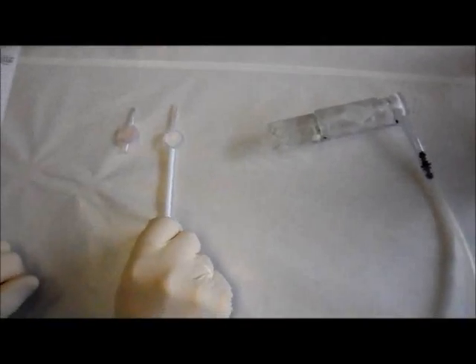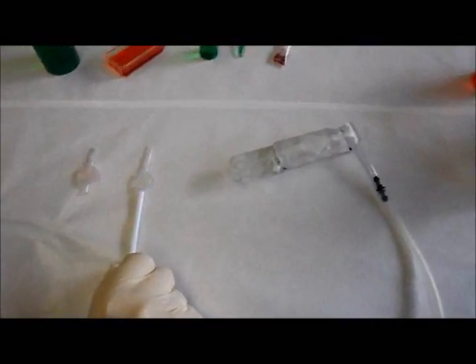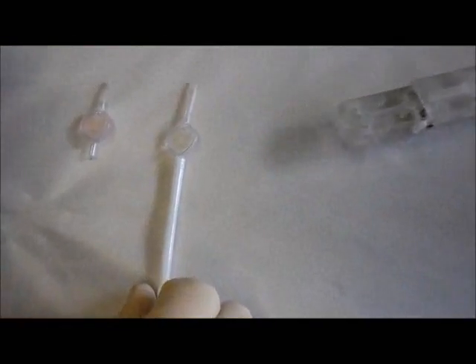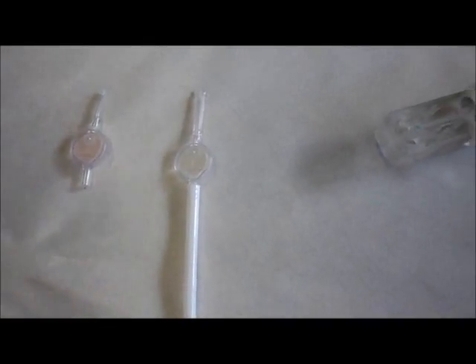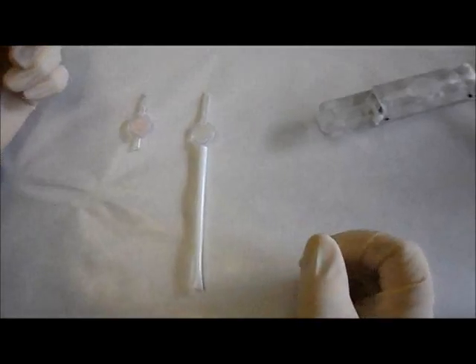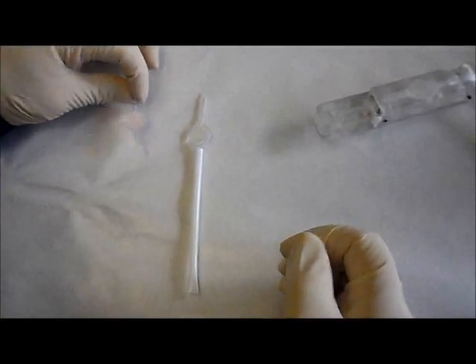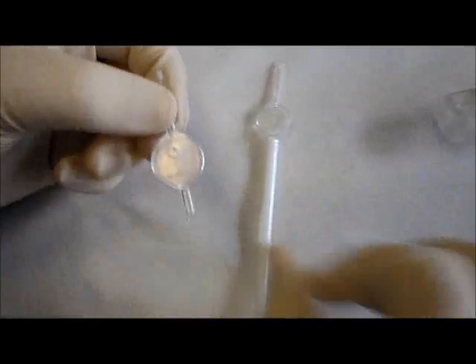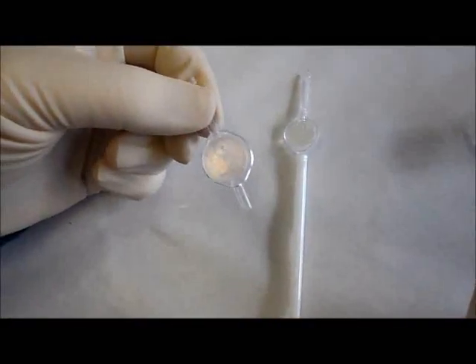What I'm about to demonstrate is a versatile enclosed filtration cartridge-based sample preparation technique that's scalable for dealing with large volume samples of liters or down to microliter samples, and it is adaptable for a wide variety of applications which you'll get the idea of in a few moments.